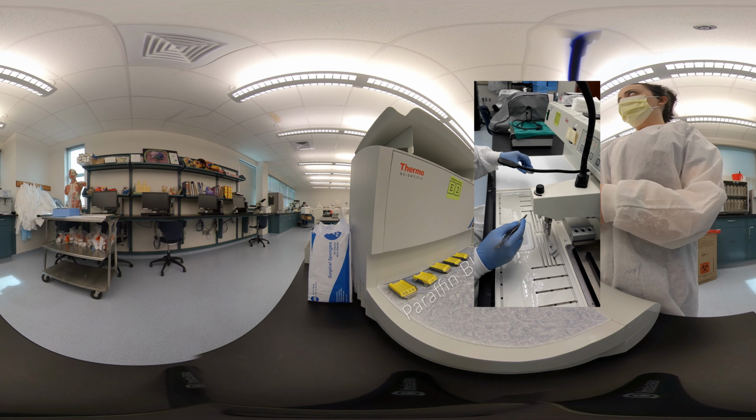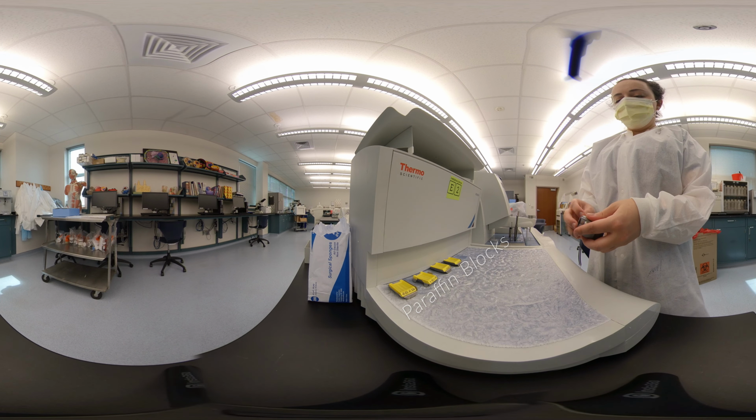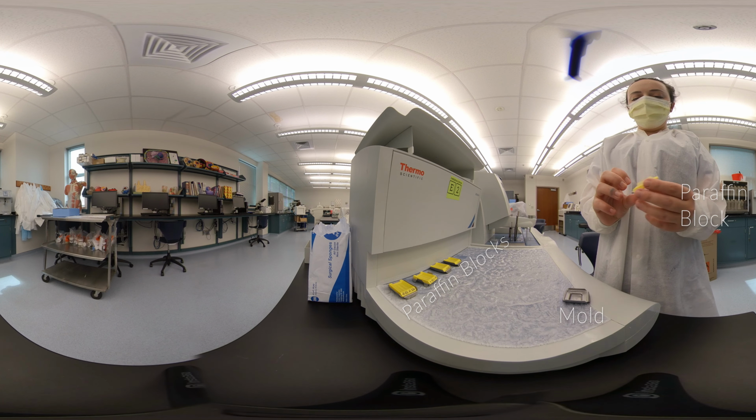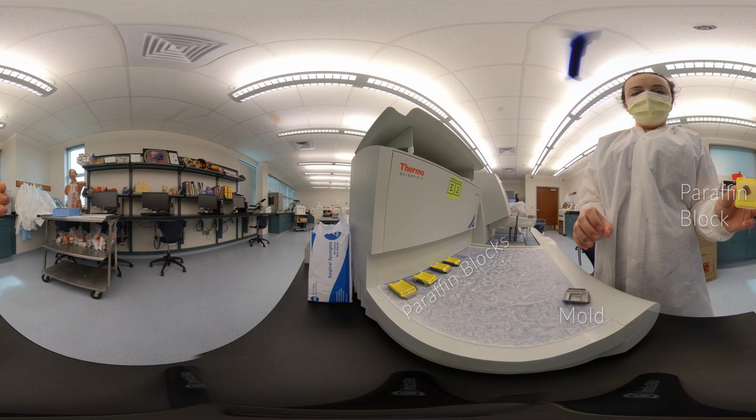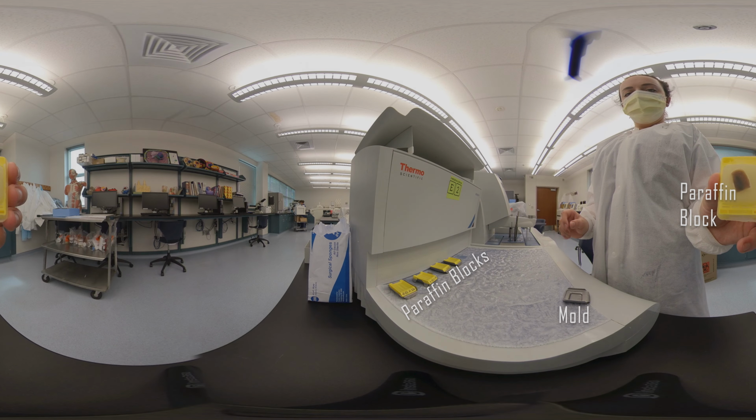As you can see from the video, a specimen is placed into the metal mold filled with hot paraffin and then oriented so it can properly be cut, and is placed on a cold plate until it is completely solidified. Here's a demonstration of what it looks like when a mold has been completely chilled and therefore solidified completely. Once the excess wax is removed, it is ready for the next area, called cutting.